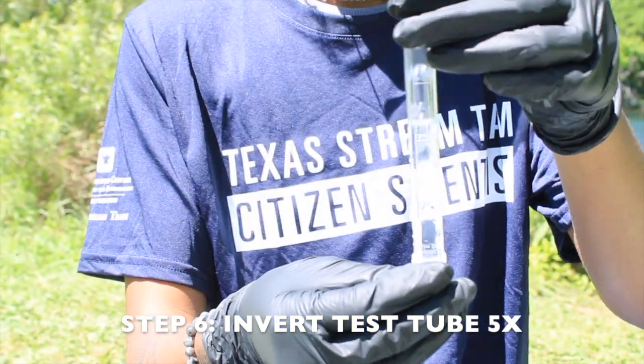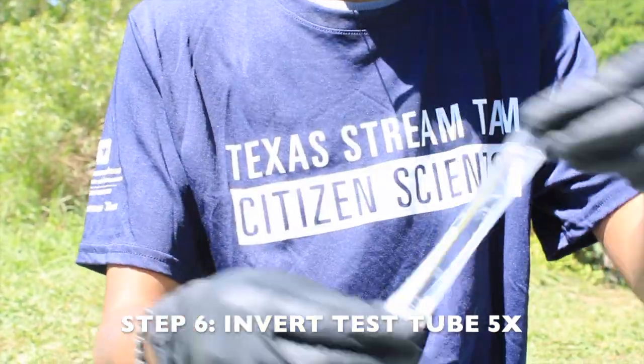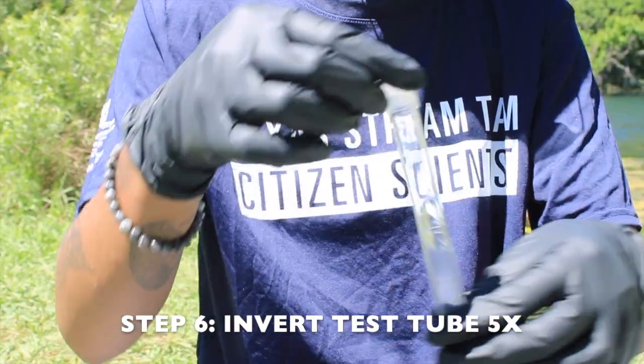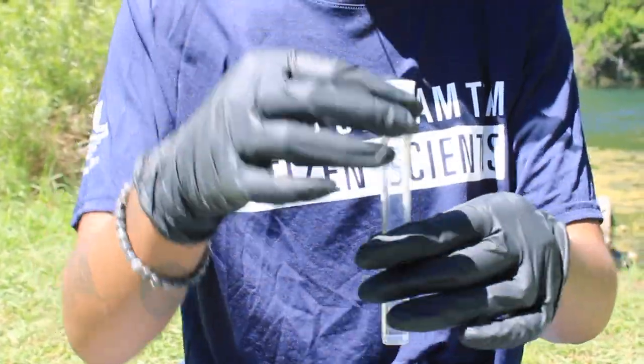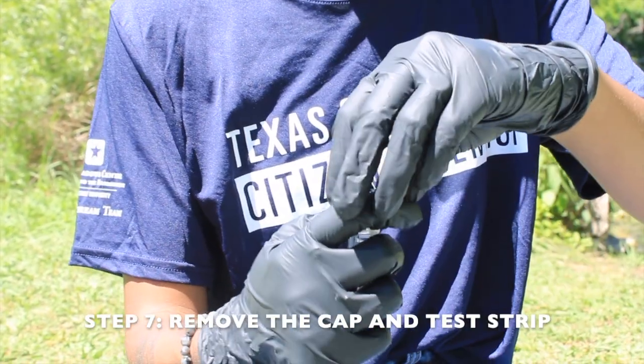For step 6, slowly invert the test tube 5 times, making sure air bubbles move from one end of the test tube to the other each time. For step 7, remove the cap and test strip.